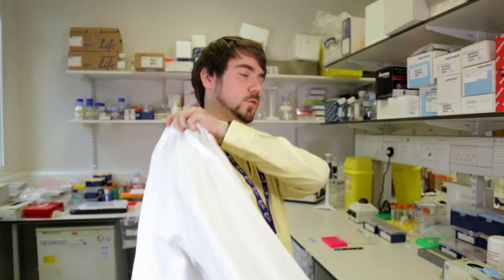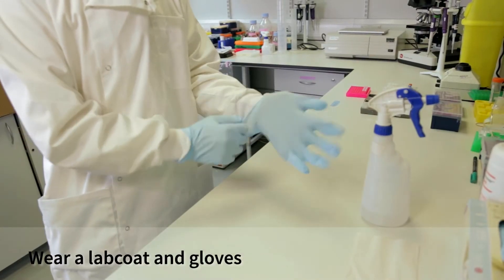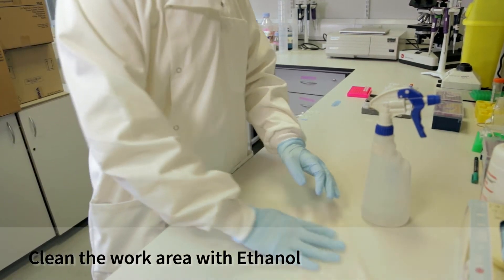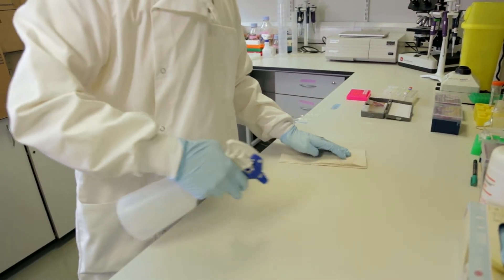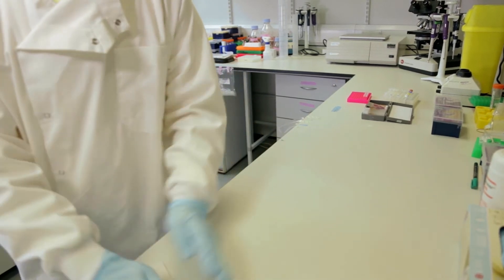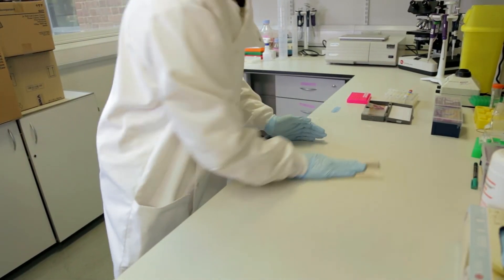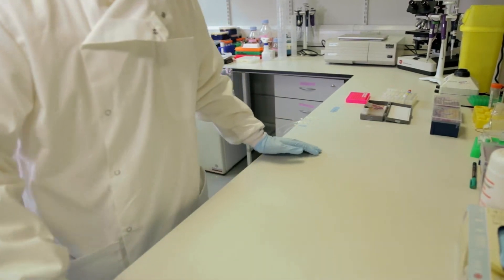Before we get anything in the lab, the first thing we need to do is put our lab coat on. There are two reasons why we wear a lab coat: one is to protect the experiment, and the other is to protect ourselves. We also need to put gloves on and clean the desk with ethanol. Wearing a lab coat prevents us from introducing contamination from our clothes, and the gloves prevent our own DNA from getting into the reaction.